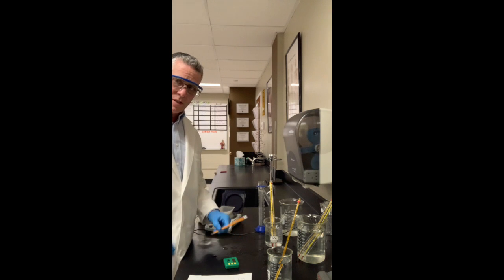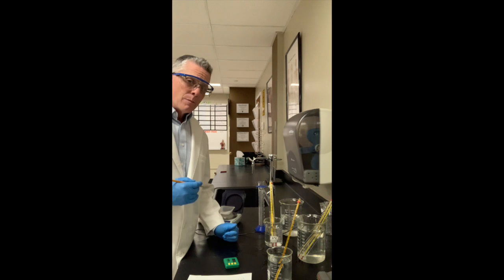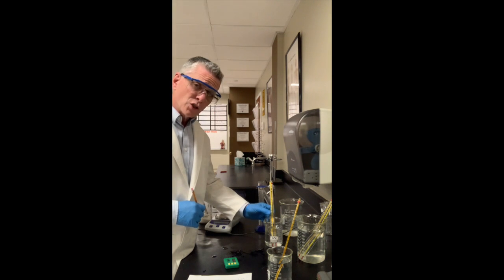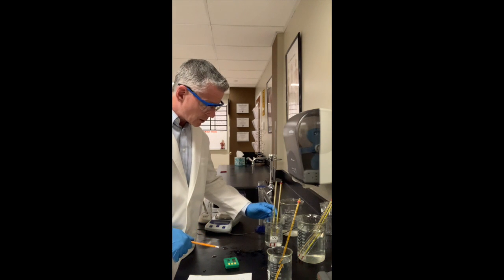I'm going to record this temperature one more time for you, and then I'm going to pause the video because it's probably going to be boring for you to watch. You see what I'm doing? We are at 45, 6, 7.